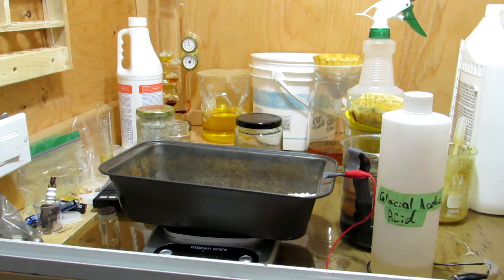Welcome back. Today we're going to be preparing some acetamide. Acetamide is used as a building block for acetic anhydride, and that's what we're going to be using it for in a future video. There are a couple of intermediate steps but that's what we're aiming for.